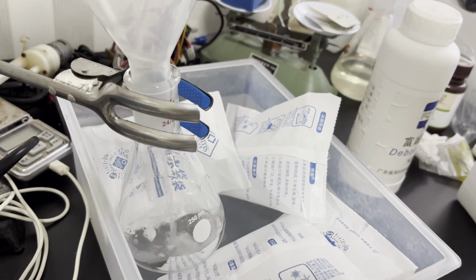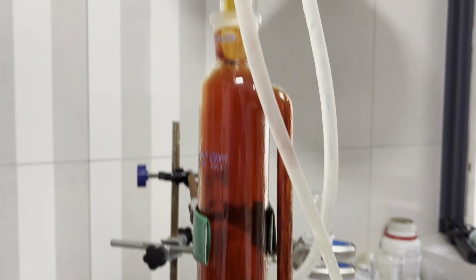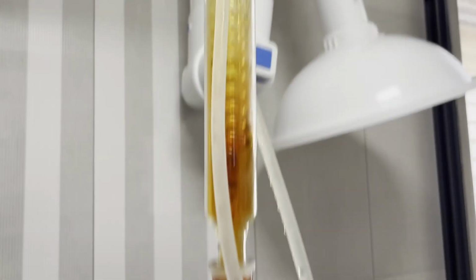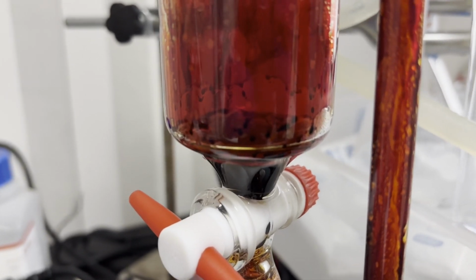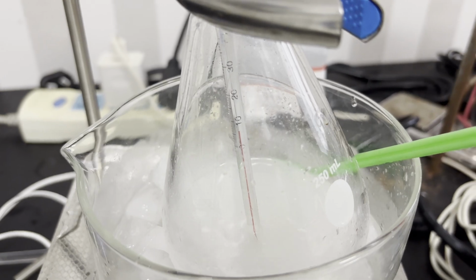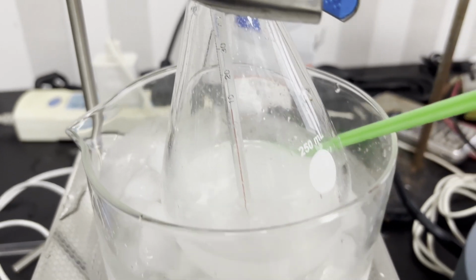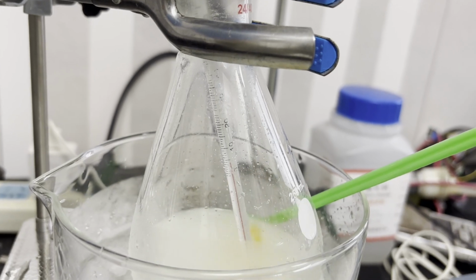I then made some bromine using 0.15 moles of potassium bromide, which corresponds to a 50% excess to my phenol. I'm not going to add all of the bromine in though. Note that I added some concentrated sulfuric acid in the funnel, so the bromine will be dry. The flask is transferred to a better ice bath, and I wait for the temperature to drop to 5 degrees C or below. The bromine is then added very slowly into the flask.